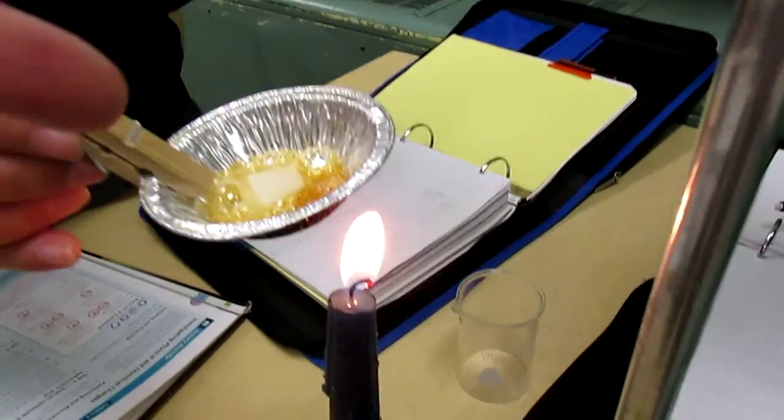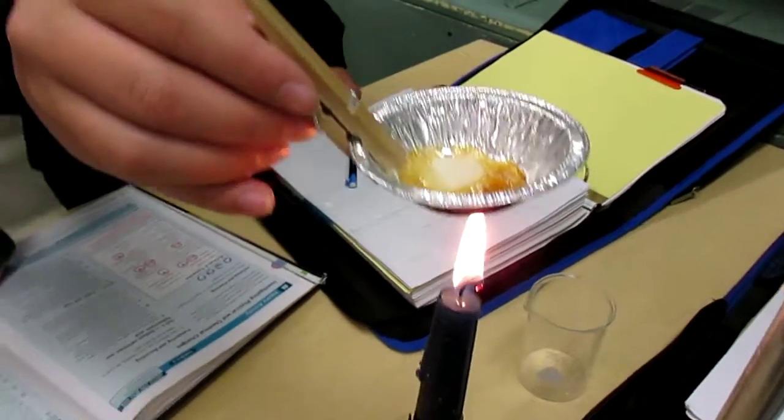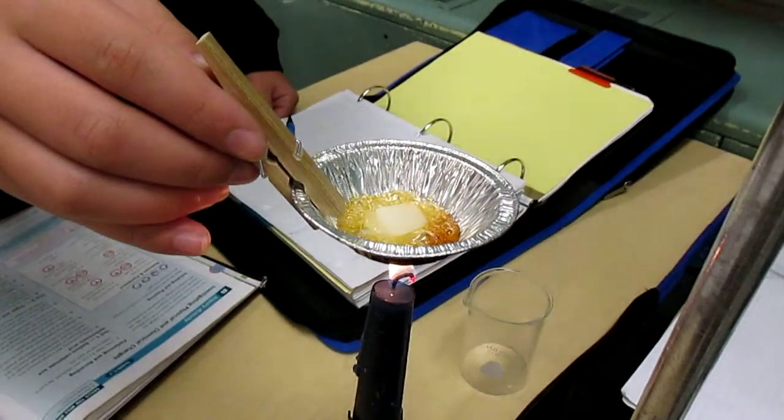Well, that turned different color too. It burnt because of the fire. Okay, so if you burn something, then you have to say it's chemical.